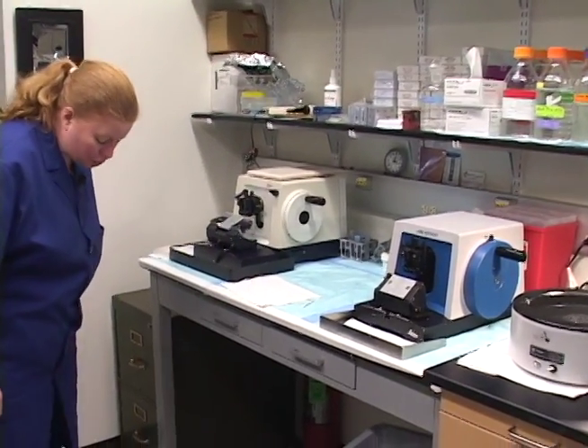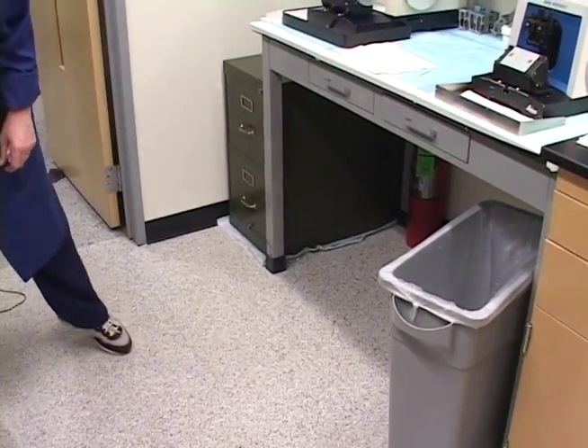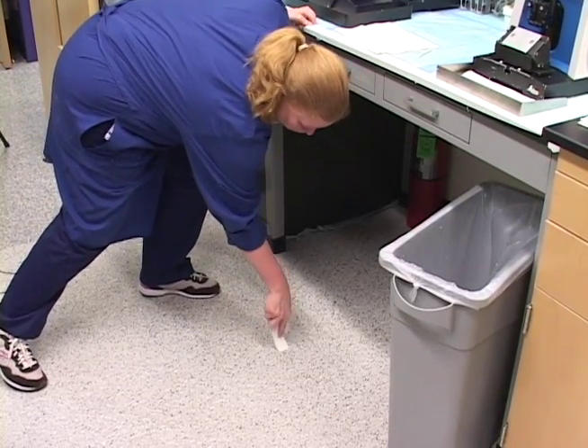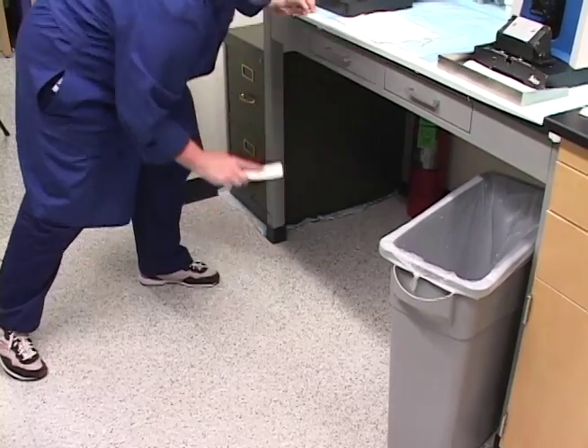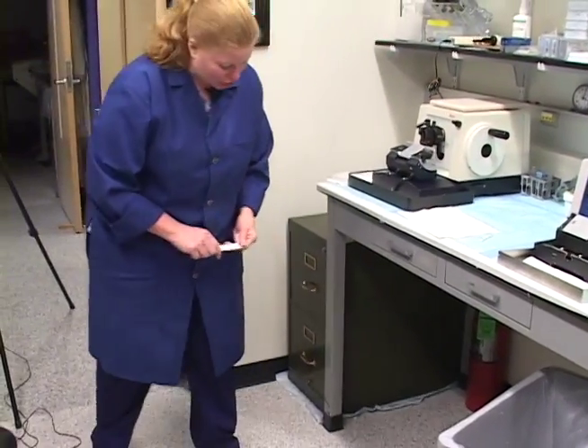You want to check the floor a little bit too, because it gets quite slippery. You can use one of the scrapers to get some of the paraffin that's building up on the floor so people don't slip and fall when they come in here, because it creates a real slick surface. So once in a while, just kind of give it a check.